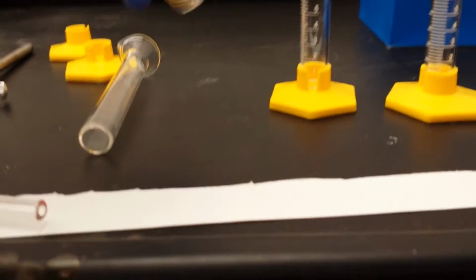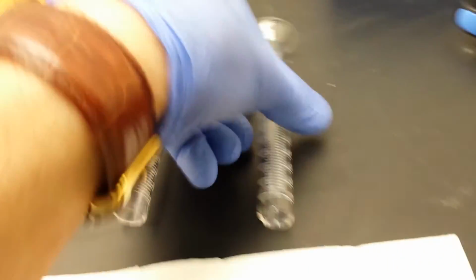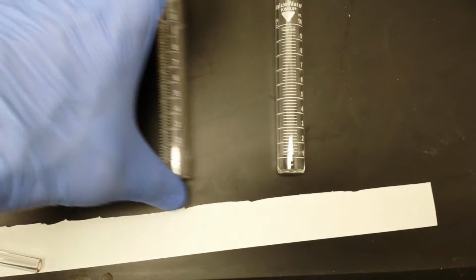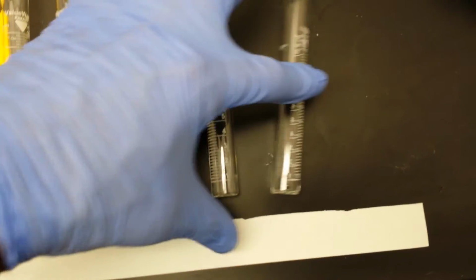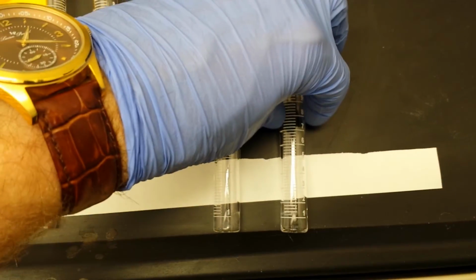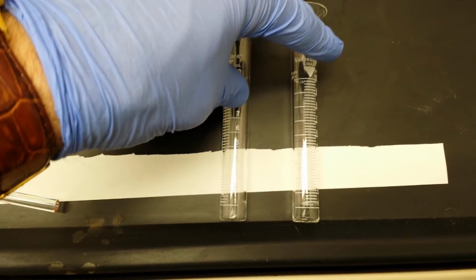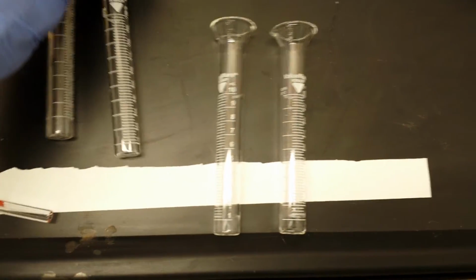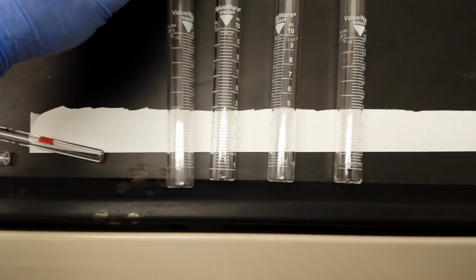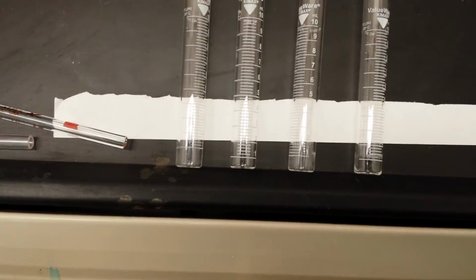So, maybe I should have taken these off before I recorded it. Let me just set them down and I'll pop off the others and I'll line them up properly here in a second. Here we are. Okay, so let me get a top view on this and line them up a little better. Oops, in fact here, we'll get it all the way down here. I'm going to use this little strip of paper just to help guide our eye on something in a second. So notice that I'm using this little lip at the edge of the hood to get everything lined up evenly.